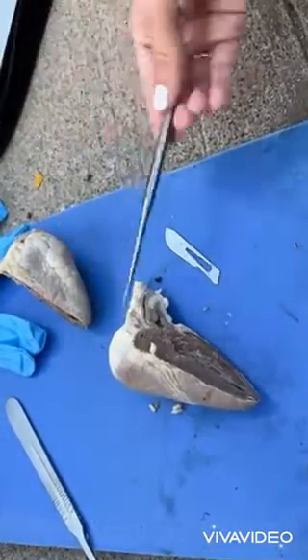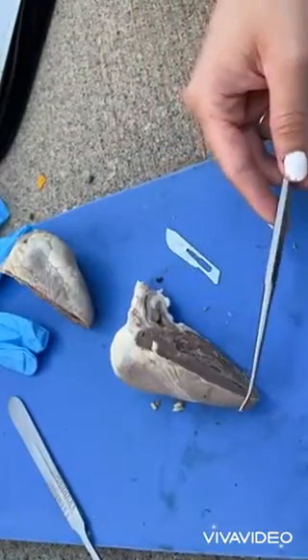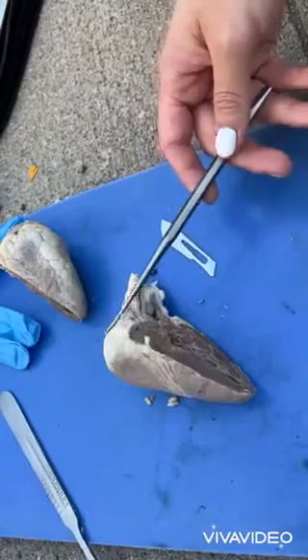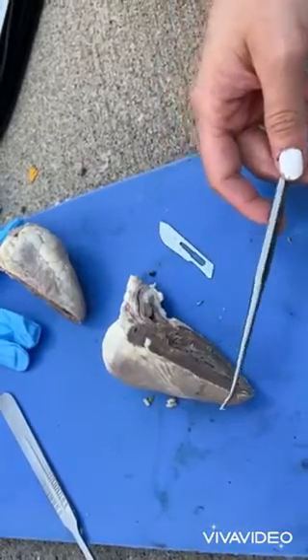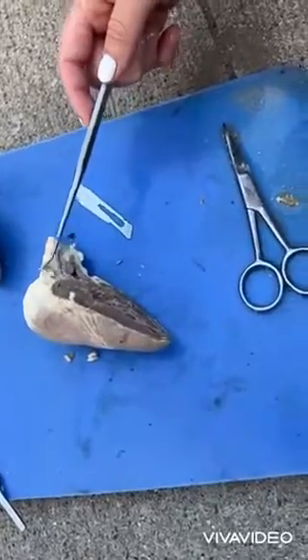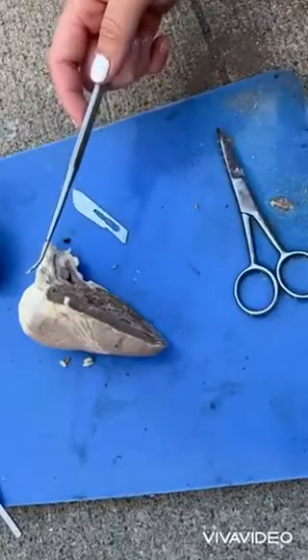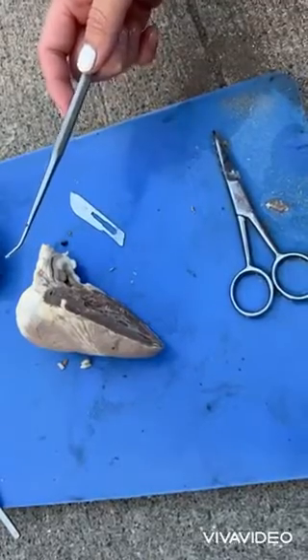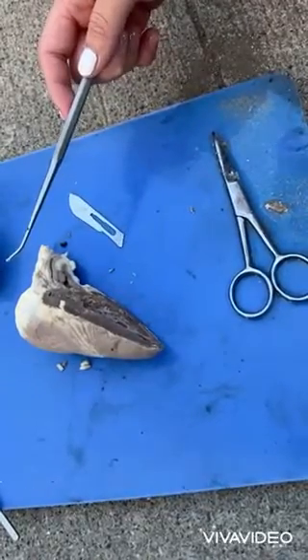Superior vena cava is the superior of the two venae cavae, the great venous trunk that returns deoxygenated blood. The trabeculae carneae are round and irregular muscular columns which project from the inner surface of the right and left ventricles of the heart.